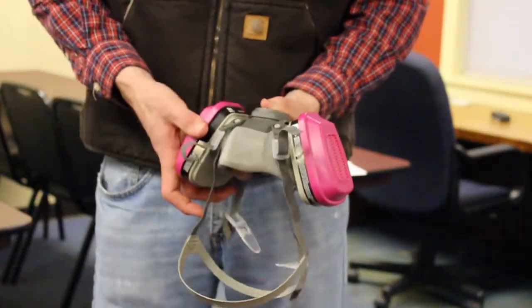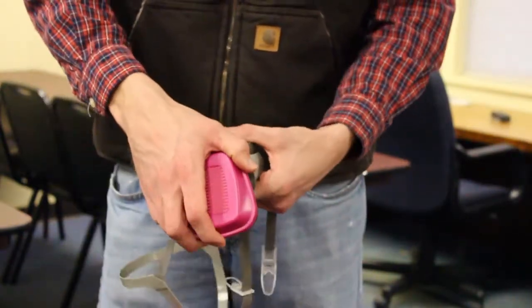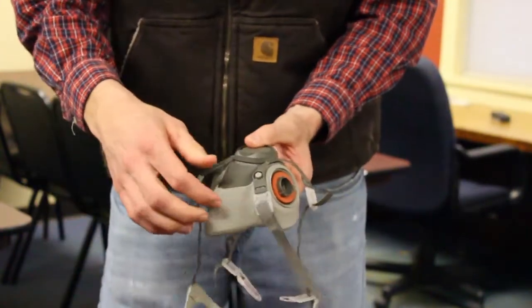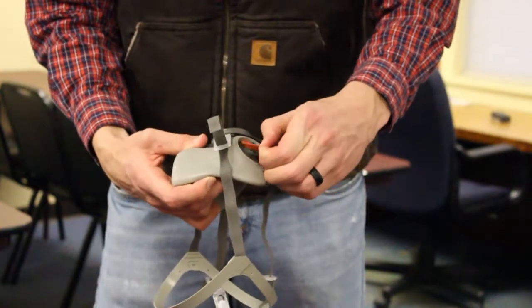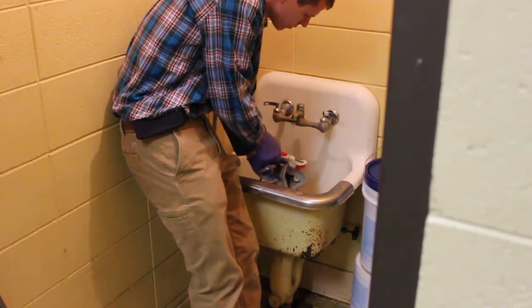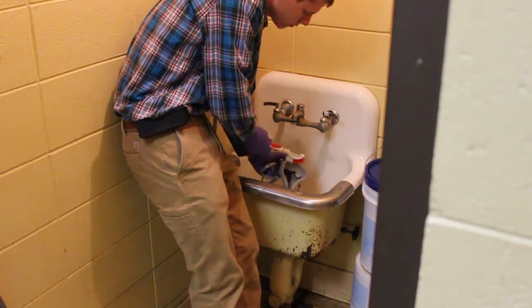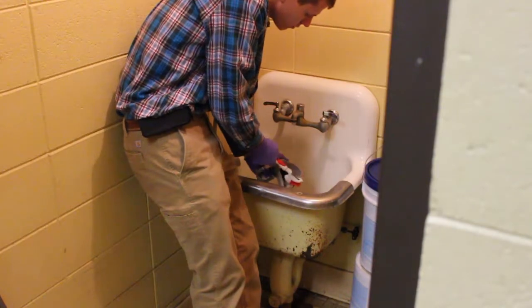Cleaning is a very important part of respirator maintenance. Remove filters, cartridges, or canisters. Disassemble face pieces by removing speaking diaphragms, demand and pressure demand valve assemblies, hoses, or any components recommended by the manufacturer. Discard and repair any defective parts. Wash components in warm 110 Fahrenheit maximum water with a mild detergent or with a cleaner recommended by the manufacturer. A soft bristle brush may be used to facilitate the removal of dirt.